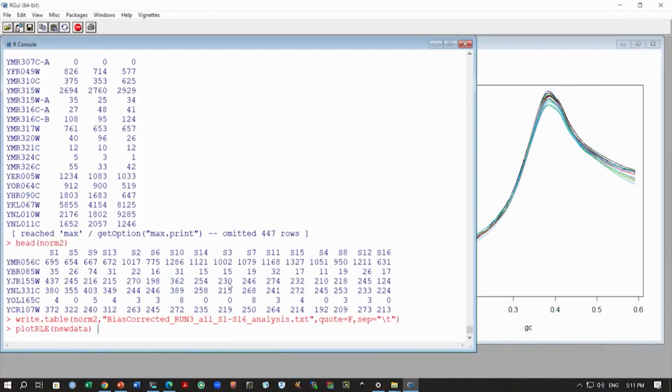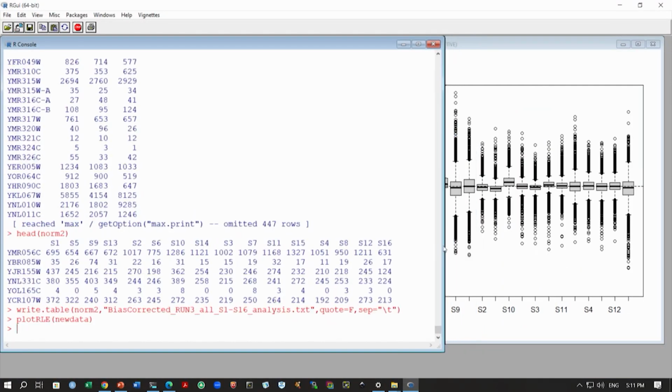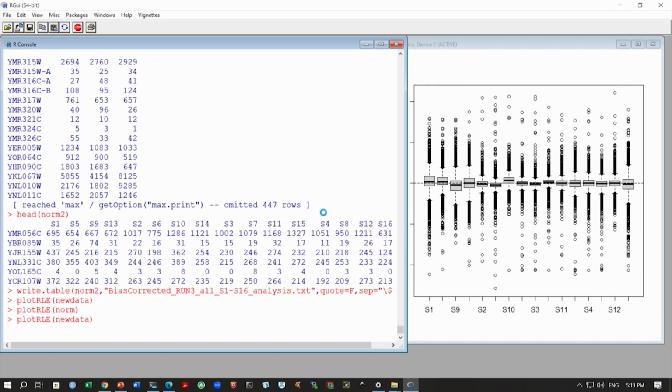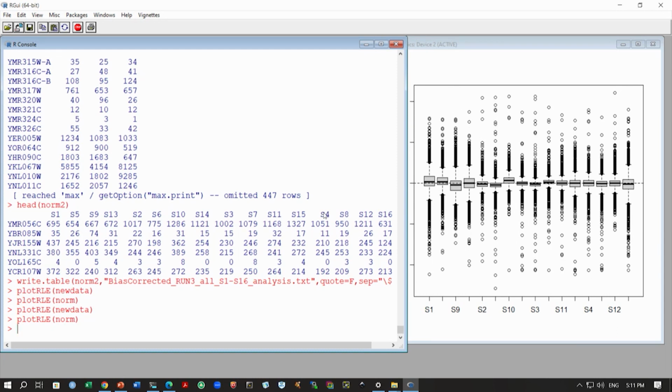Okay, so this is what we are going to do, and I will just move this a little bit so that you can see the data. These are the S1 to S16 samples, and you can see this is before normalization. And after normalization, you can see there is some difference. Again, depending on the type of normalization, this will change. You can see the distributions have changed a little bit. So this is what bias correction will do. Here we have corrected only for GC bias, and of course, we can take other examples. You can do this for other methods.